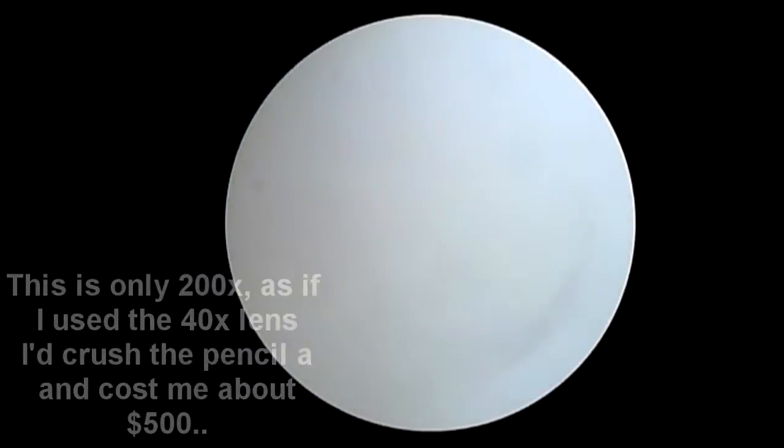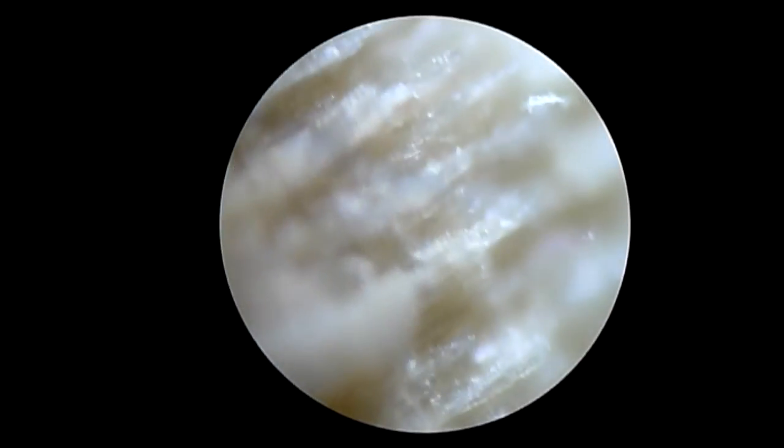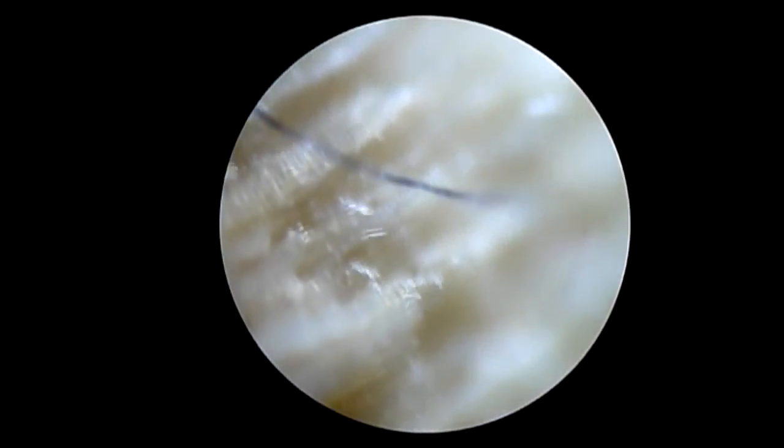Now I'm not touching the microscope at all. Basically my breathing is making it move. I can see just incredibly small vibrations. And then we'll just move out to the wood. Oh, that's that hair we saw before.